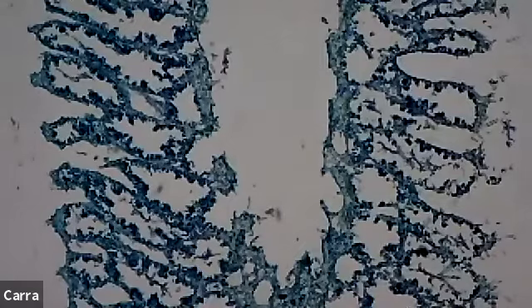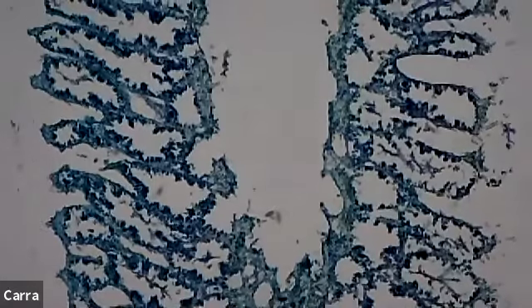And this is a longitudinal section. So what we did was we took a nice thin cutting of a sponge. What we're looking at here is on either side, the fibers of the sponge, the spongin probably. And then you're seeing the pores, those indents where the zigzag is going. And then in the middle, there's this big gaping hole. That's going to be the spongocoel, or the main cavity of the sponge. So let's keep moving up.